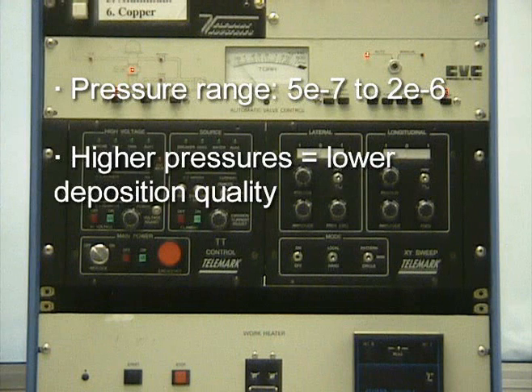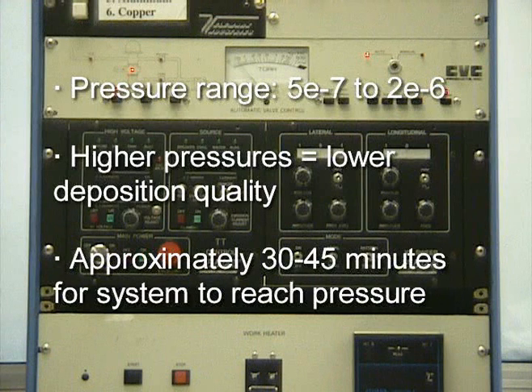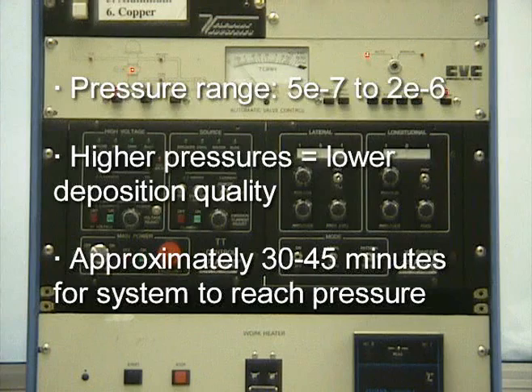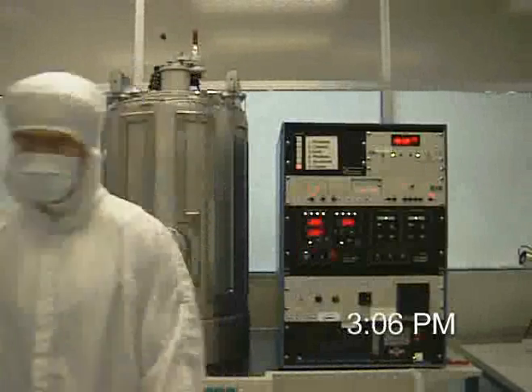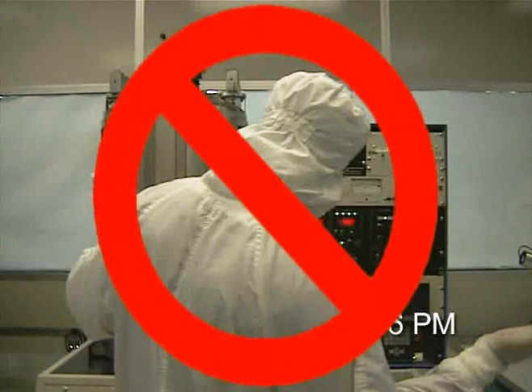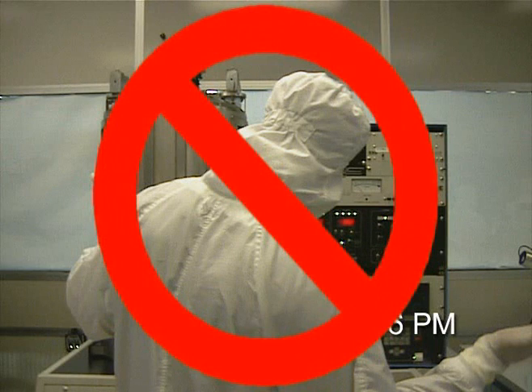However, if you are not concerned with the deposition quality, you can start at higher pressures. If you want a low pressure, it may take 30 to 45 minutes for the system to reach the pressure you want. Do not leave the area while waiting for the chamber pressure to decrease. You must monitor the E-beam to ensure that the system is functioning properly.